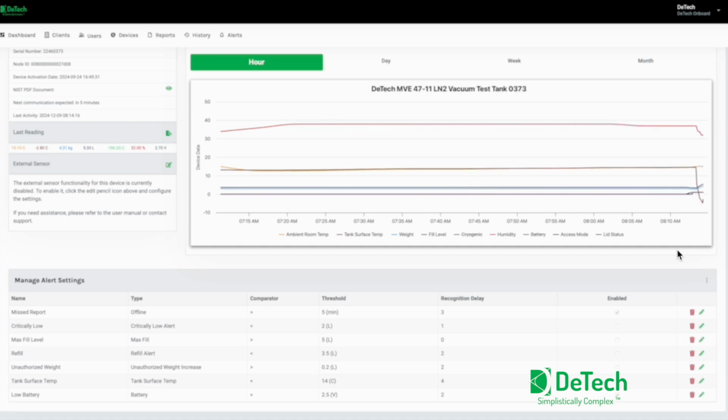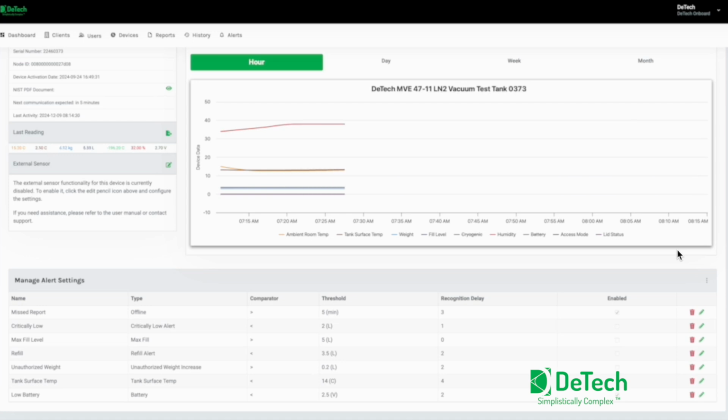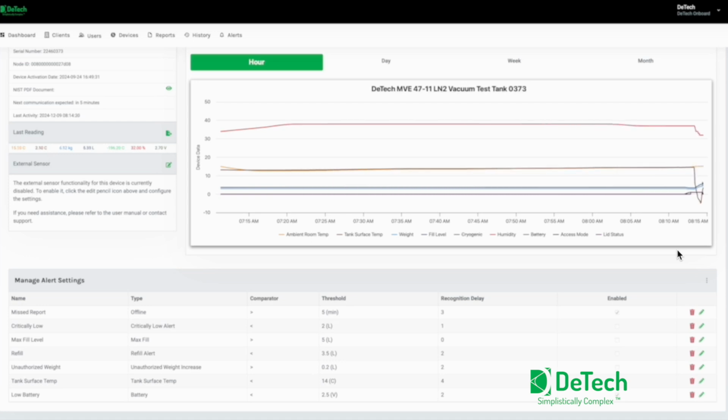That'll automatically terminate the access mode and put the device into what's called stabilization mode. See, that's already happening, and you'll stop seeing the telemetry come in real time. I think this might be getting close to the end. Yeah, the lid is on right now and it's in stabilization mode.